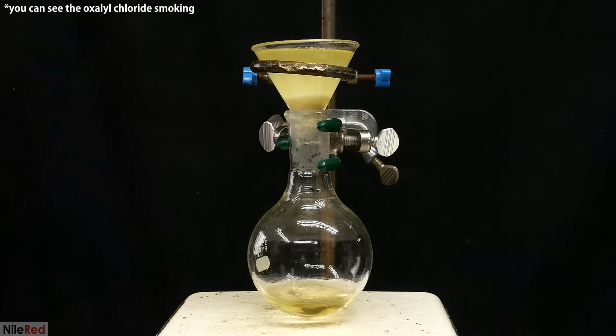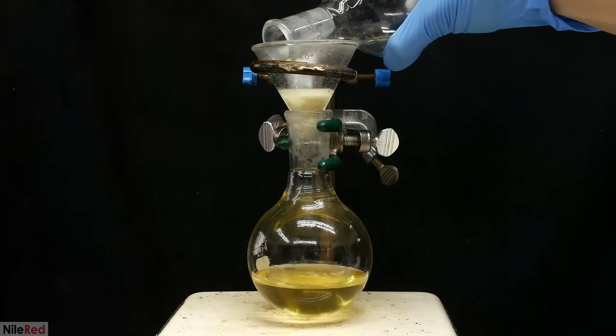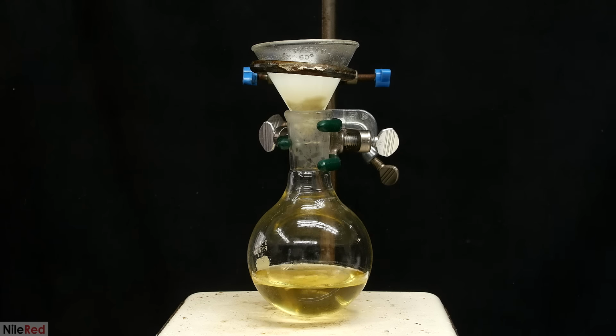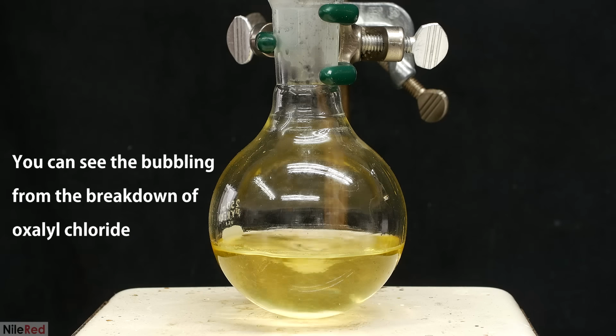One thing that's helpful is that we have excess oxalyl chloride left over. Oxalyl chloride is much more reactive, so in theory, it should be able to pick up the water and protect the adipoyl chloride. Once everything had passed through, a small amount of dichloromethane was used to wash the round bottom, as well as the funnel. When this was done, I took away the funnel and I dropped in a stir bar.